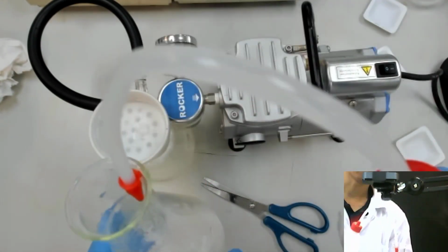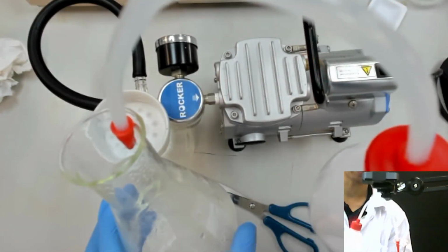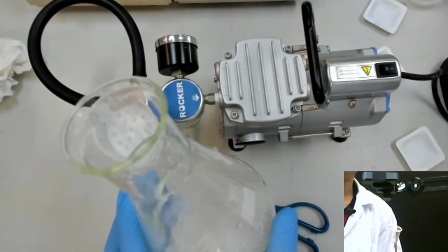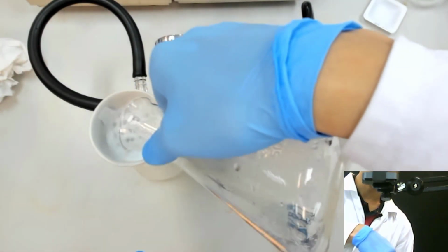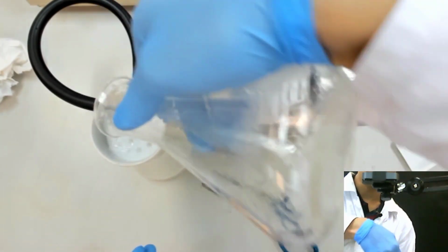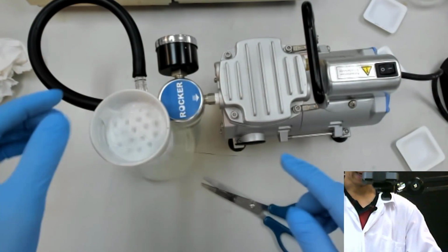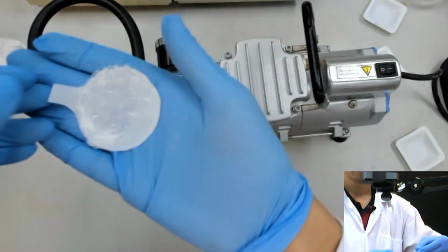And then you can just put water, because remember, our salicylic sample is not dissolved at room temperature. So that's why it's okay to put water there, because it will not dissolve anyway. Okay, so you go like that. Let's say done, finished. And then you close this, and if you take it out, you see there.